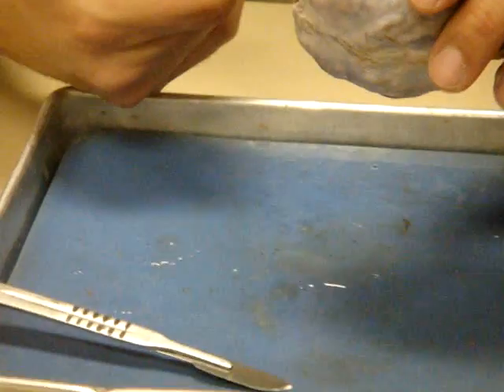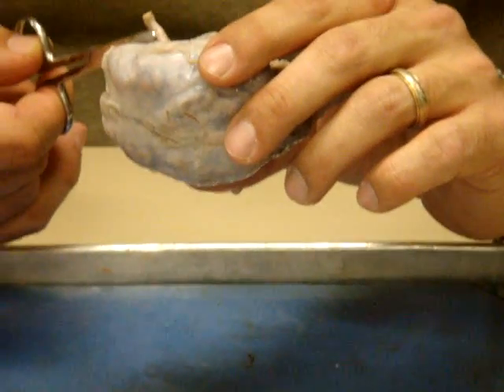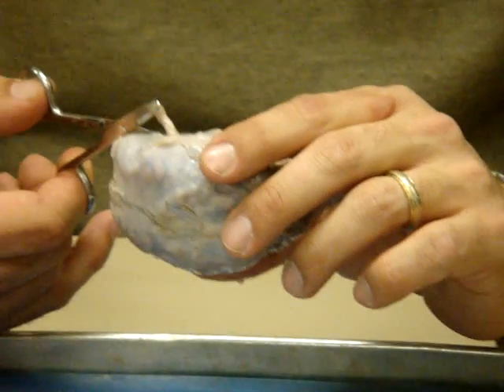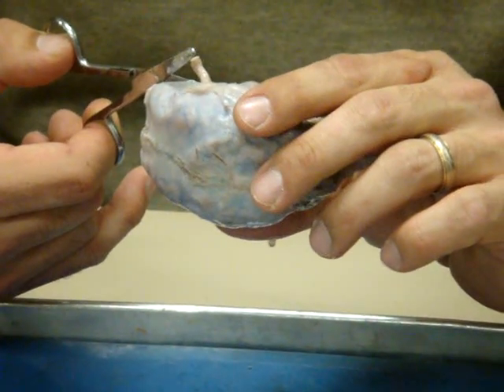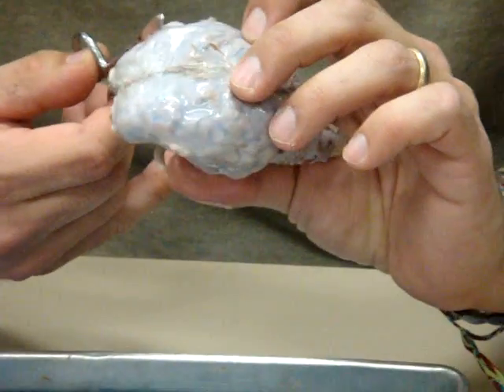So what I'm going to do is start where it's already opened here, and some of them may already be ripped a little bit. And I can cut through this dura. Just be careful when you're going in. I'm lifting up the dura away from the brain. I don't just want to jam my scissor in there and ruin the tissue. But I'm going to bring it this way, and I'm going to cut across the top of the brain here.